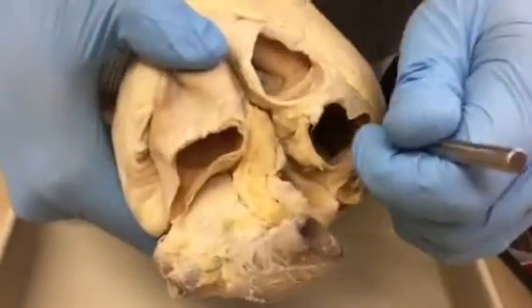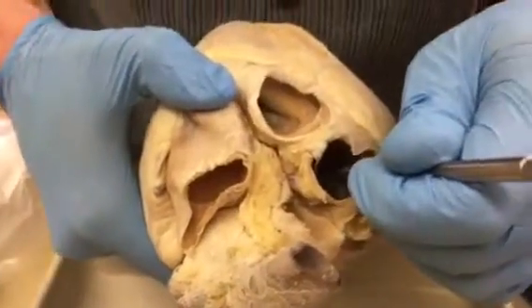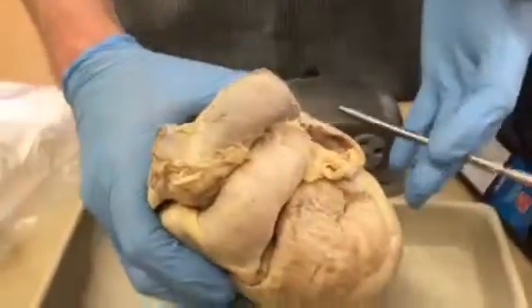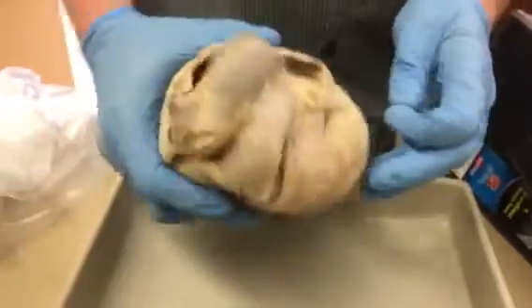The bicuspid's in there, and there's one big flap on one side and one big flap on the other side. Okay? So that one's fine. Now, the semilunars are also a little hard to see because they're way up high here.